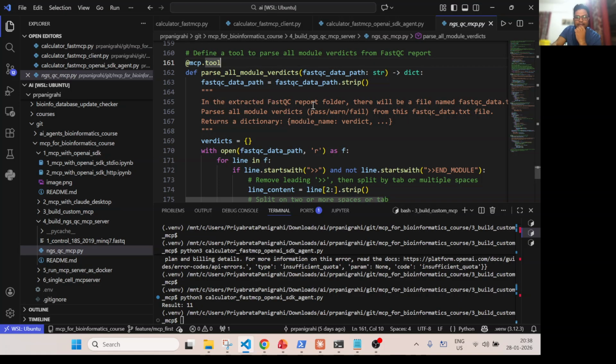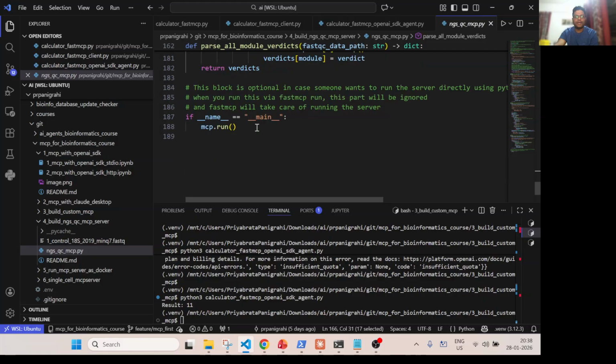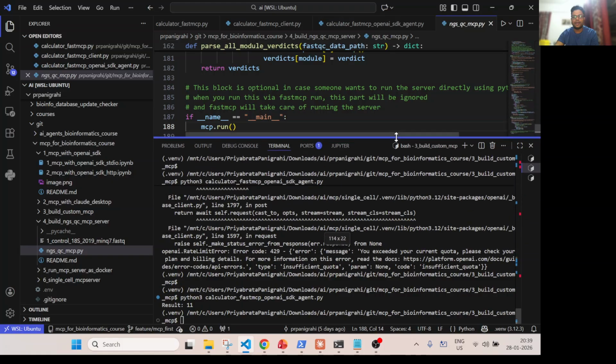In the last one, I'm telling it to again parse that fastqc_data.txt file and give me all verdicts, because FastQC has many QC modules. So I'm giving this function, where I will tell which module passed, which failed, which gave a warning. This function does that. And finally, this block is optional, because as I said, we will not be using mcp.run. We will use the fastmcp run command. So perfect, now this is our MCP server.